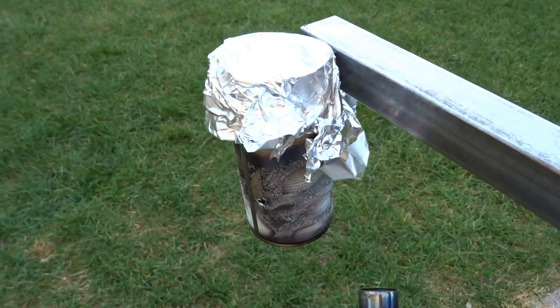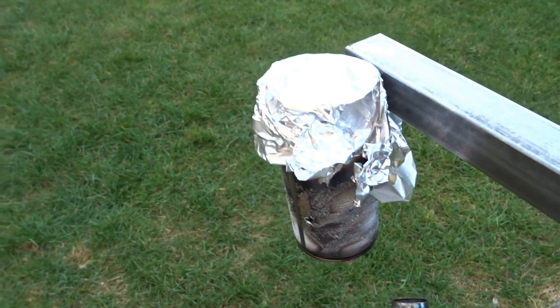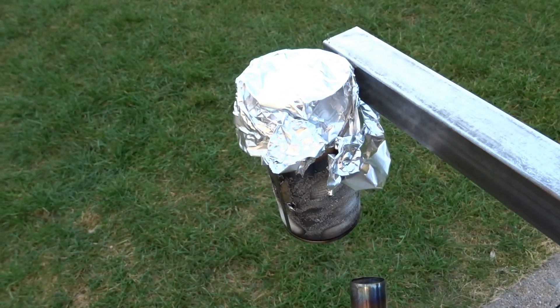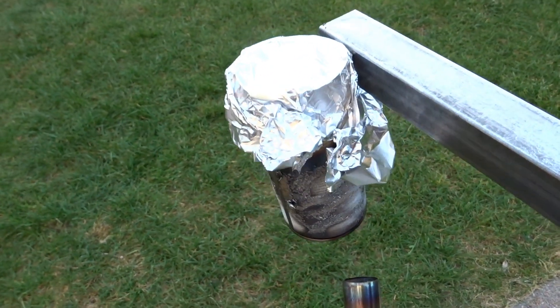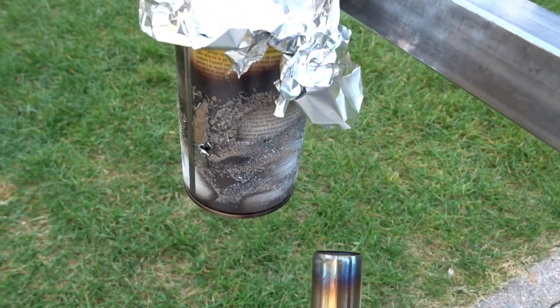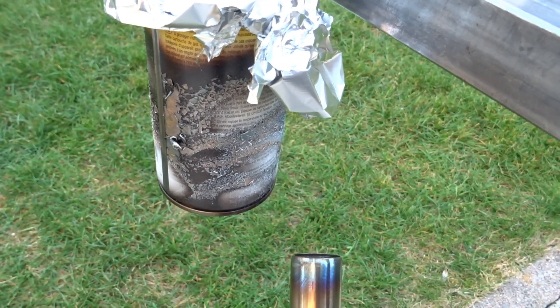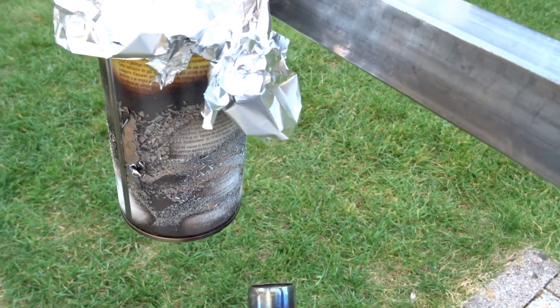Oh that paint! Okay. The dish went boom boom due to excess heat. So I came up with this new system. And I covered it with aluminum foil and most of the paint is gone. So this should work now. Hopefully.